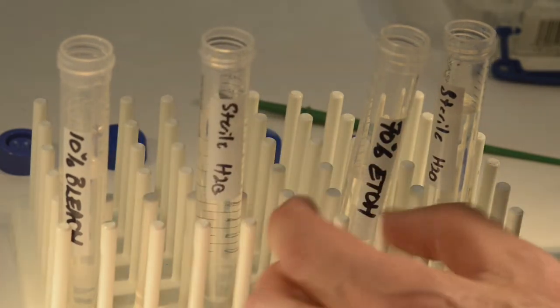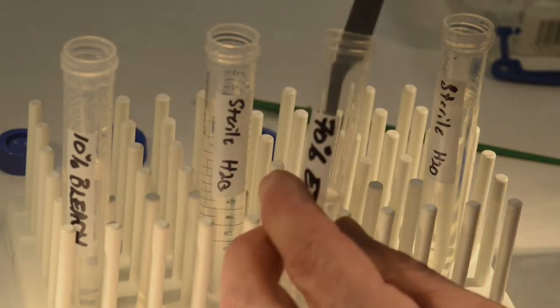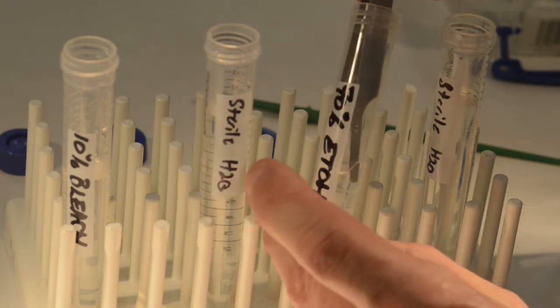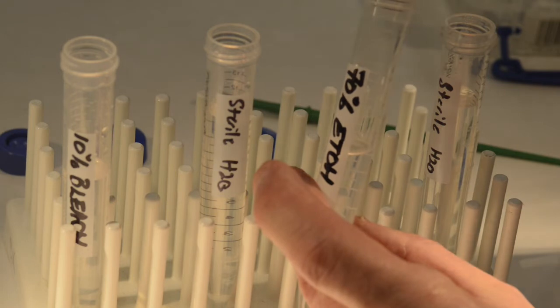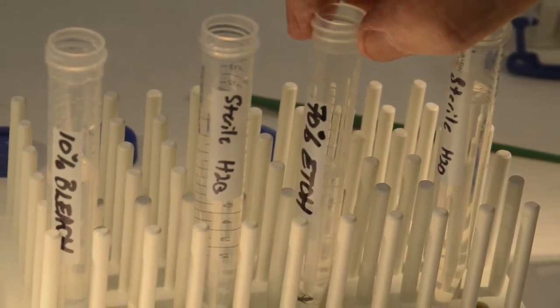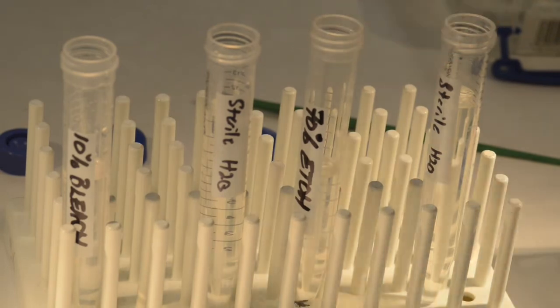But you'll notice that I make a mistake here — I accidentally dropped the beetle in the 70% ethanol. Not a problem. You get a small dish, pour the whole liquid out into the dish, retrieve the beetle, and keep going. That's exactly what I did.